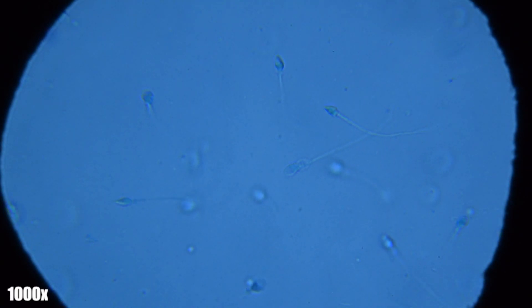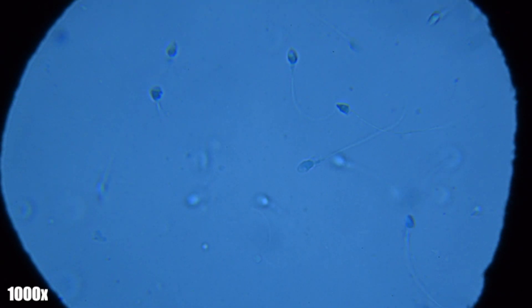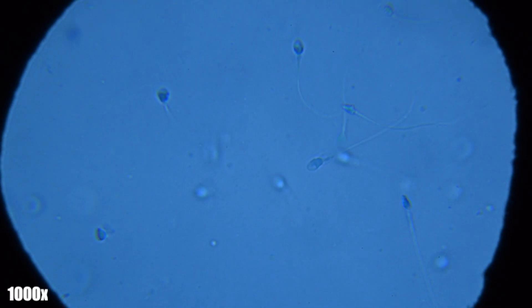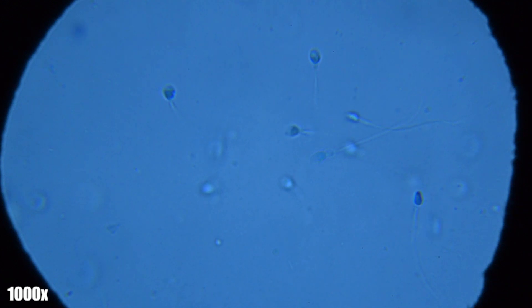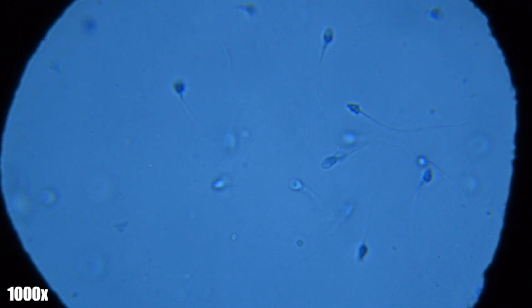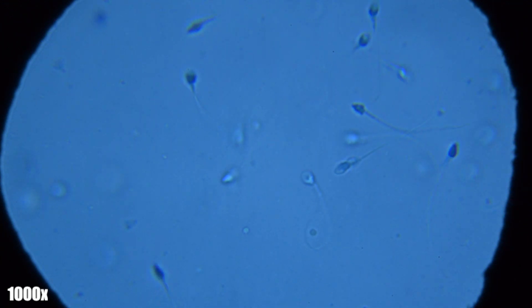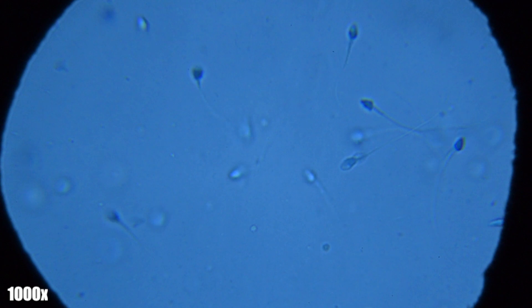Here are some of my sperm at 1000 times magnification, and you can very easily make out the flagella and the head that's covered in the acrosome.